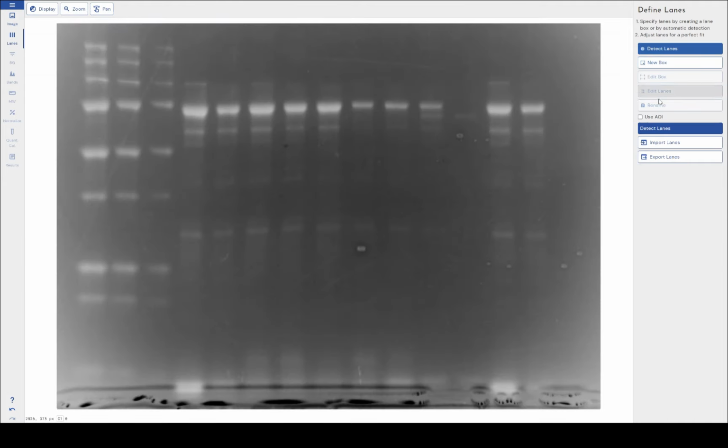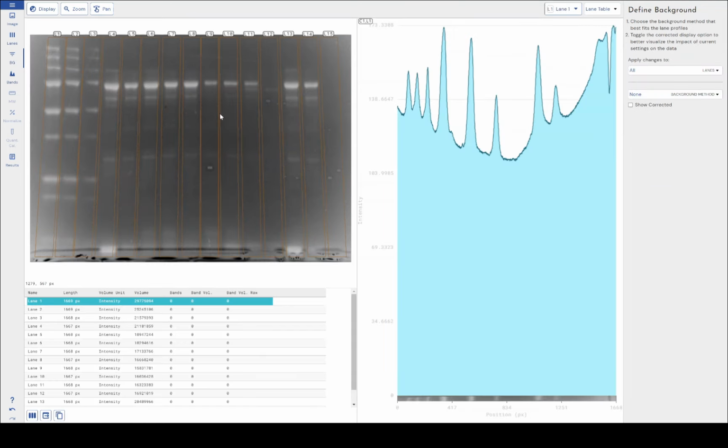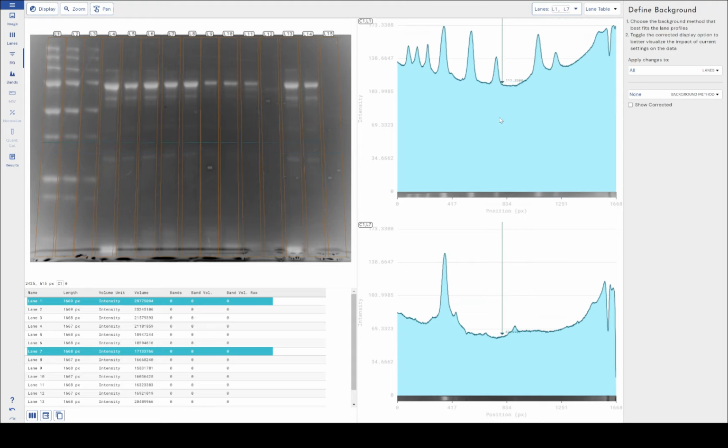I'll just drop some lanes on so I can get through to the background section. I'm aware that these lanes aren't perfect, but this is a video about background subtraction, not lane definition, which I will do one on at some point. So you see here, I've come through to the background selection stage, and if I just bring up lane 1 and lane 7, you can see that as we move through the profile, we can see that represented on the left-hand side by this blue line in our image.